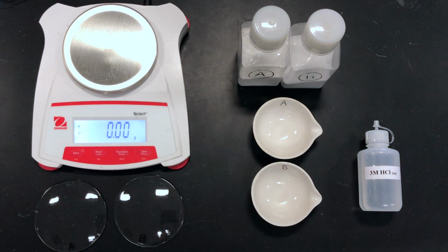Therefore, the amount of salt that we obtain experimentally will help us identify the original salt that we started with by using our balanced chemical formulas, our chemical formula writing, and our stoichiometry. Let's begin.